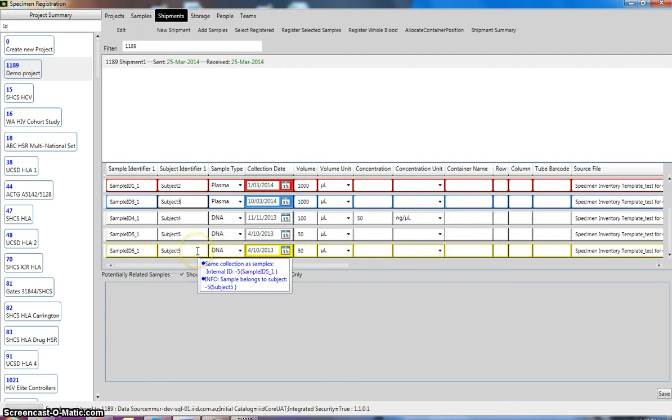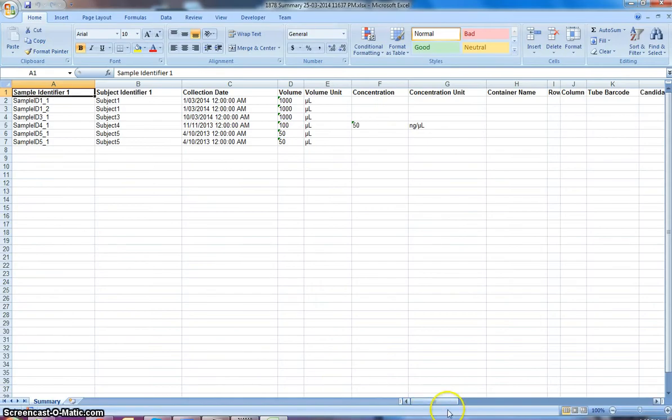The sample down here, which is also in yellow, just means that it's a duplicate sample because it has the same subject, same sample identifier, same collection as the sample above here, and that's fine. So we'll just select these samples and register these as well. And once again, an Excel spreadsheet pops up.